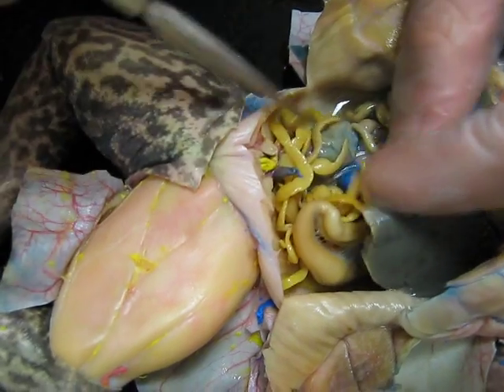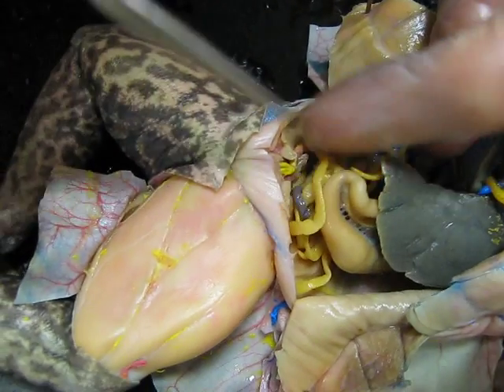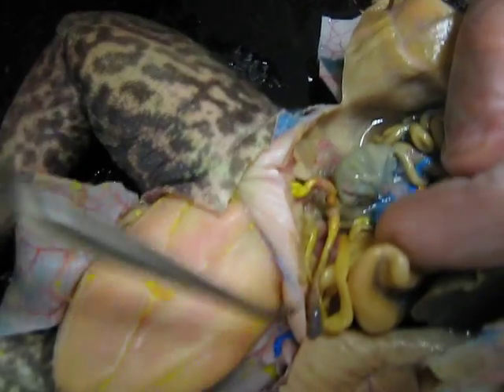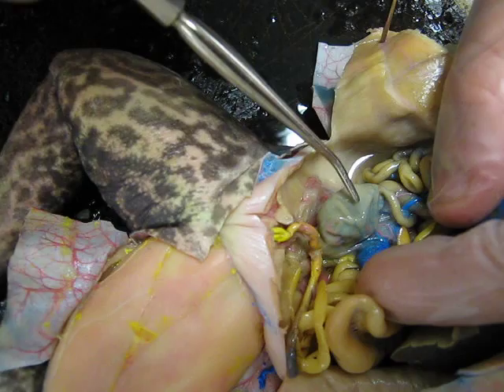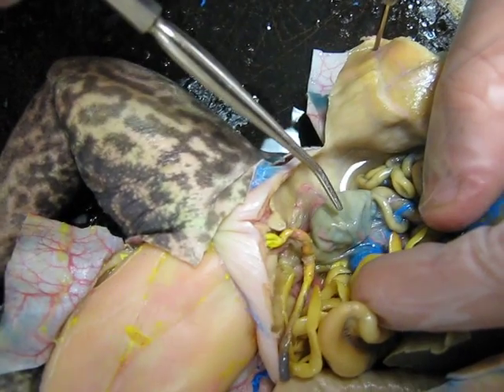This goes into the large intestine, which is this space right here — the large intestine.